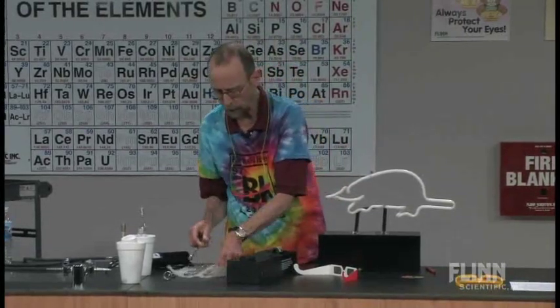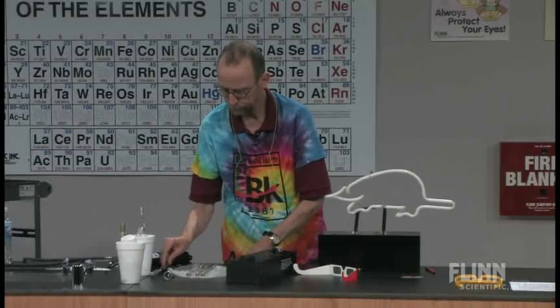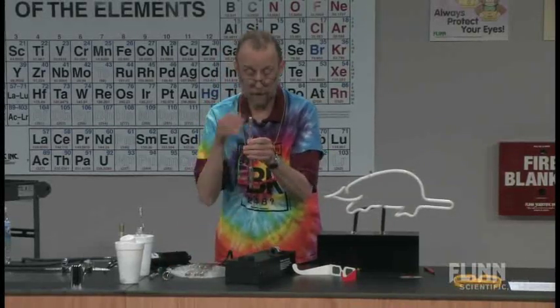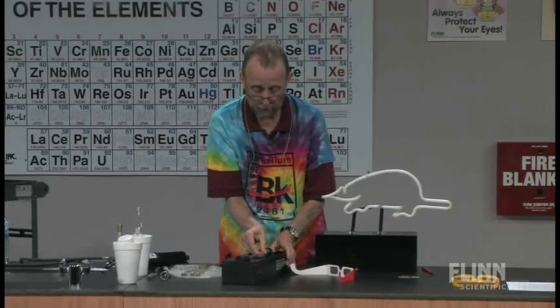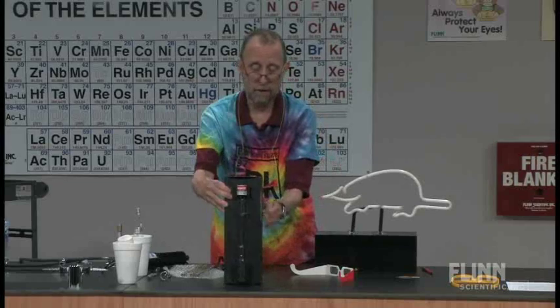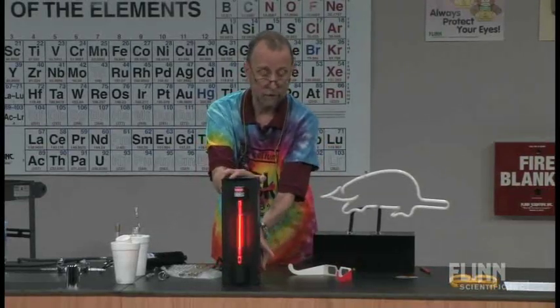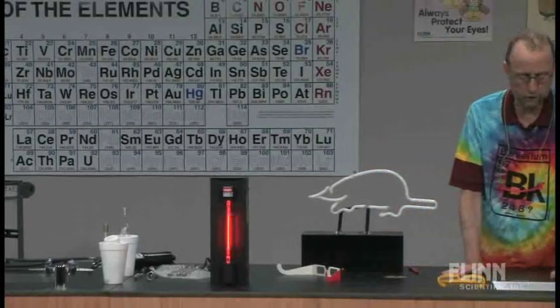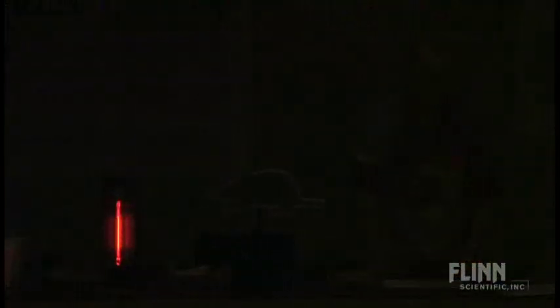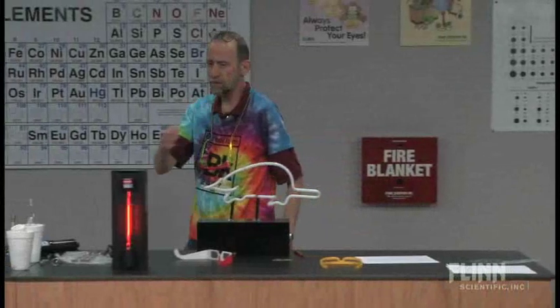Let me put another element in there — this is neon. You've all seen neon signs, and this is what most students think of when they think of neon: the signs in windows. This is the particular element that most signs used to be made of. So let's dim the lights on that.